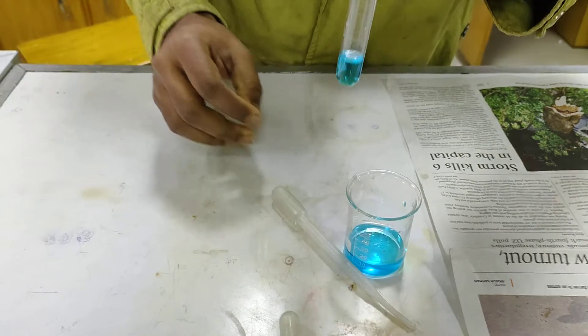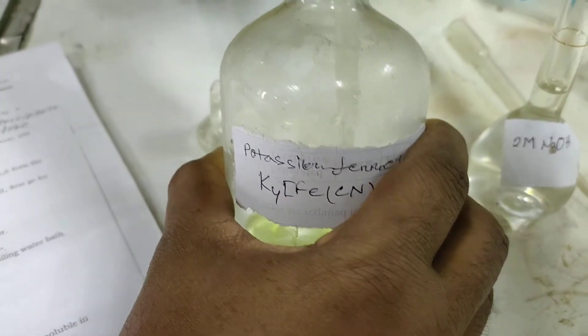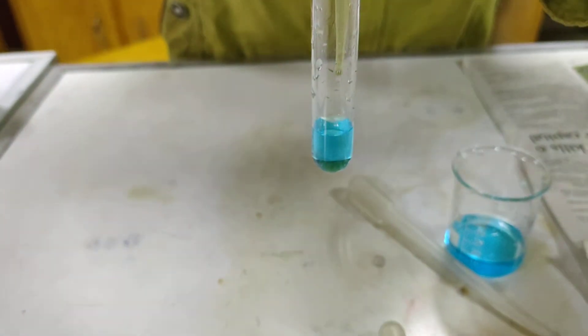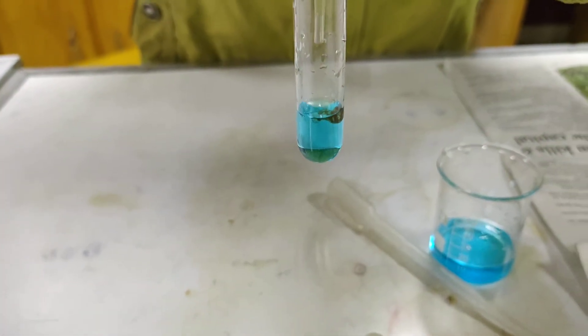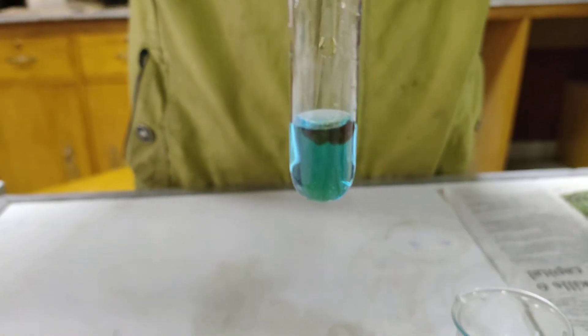We are taking another 2 ml sample solution in a test tube. Now we are going to add potassium ferrocyanide — this is another test. Adding 1 or 2 ml of potassium ferrocyanide solution. This will produce a chocolate brown color — and this is the chocolate brown color.